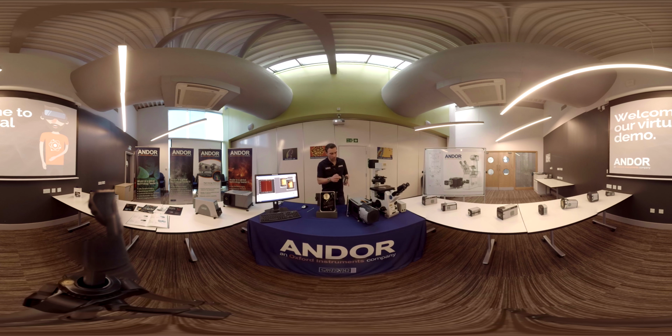On the side of the turret, there's an RFID tag, which is read by electronics inside the unit. And that means if you want to swap in another turret, the system will read that information off the turret and automatically update everything with the new information. So there's seamless integration of a new turret. There's no need for any user data entry.